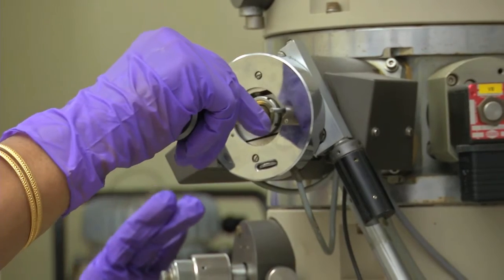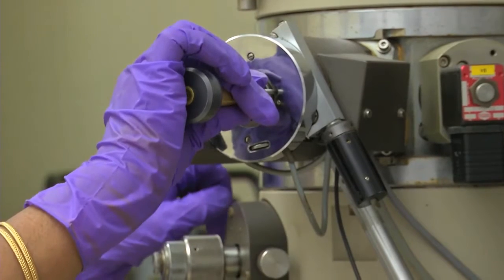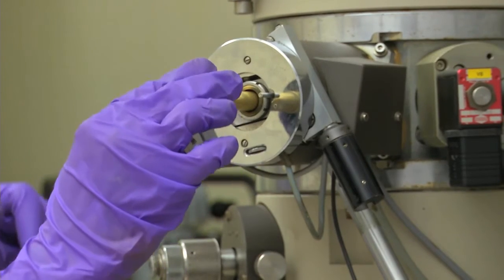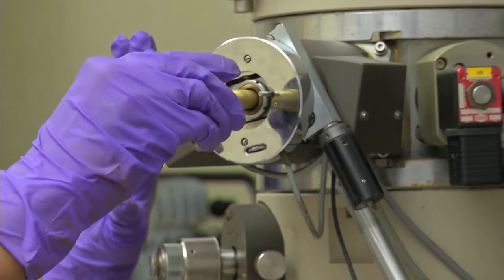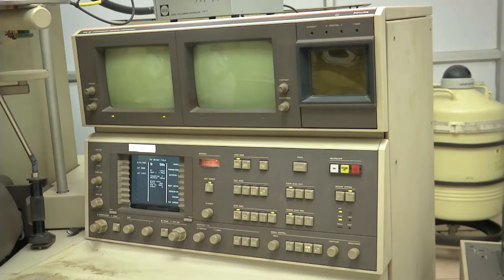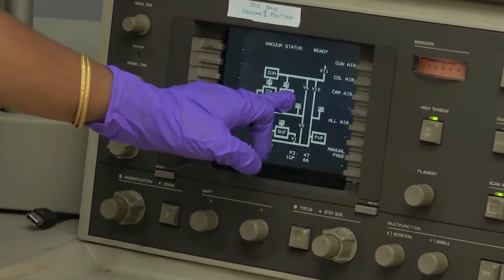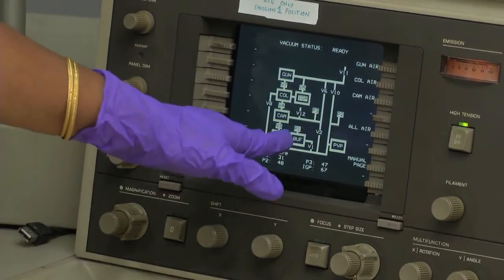Because I disturbed the vacuum in the specimen chamber, it is now evacuating. This chamber is the specimen chamber. The pump is running and now it has been evacuated. I am inserting the specimen holder inside the microscope. Here you can see the layout of the vacuum system: we have a rotary pump, oil diffusion pump, and getter ion pump — all microprocessor controlled and isolated with pneumatic valves.